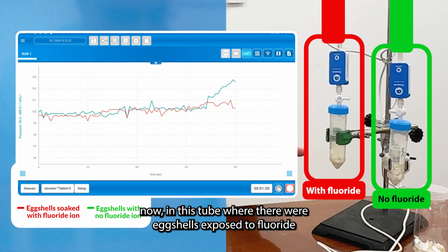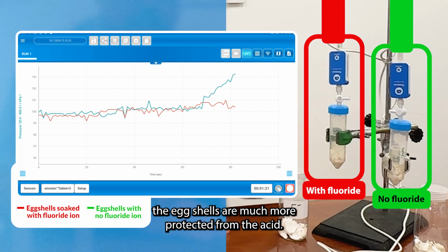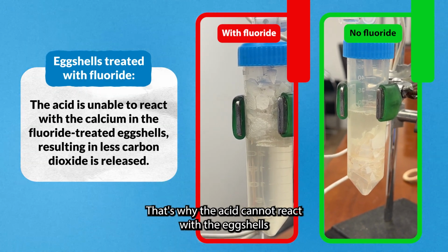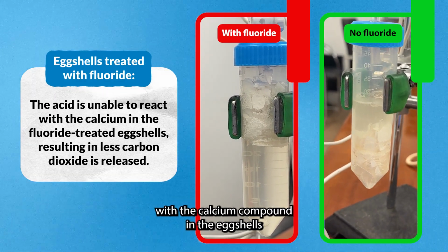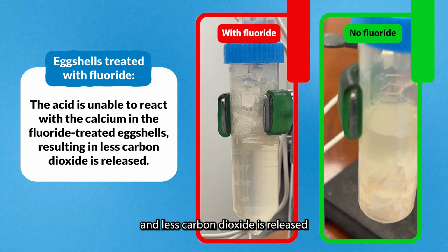Now, in this tube, where there were eggshells exposed to fluoride, the eggshells are much more protected from the acid. That's why the acid cannot react with the eggshells, with the calcium compound in the eggshells, and less carbon dioxide is released.